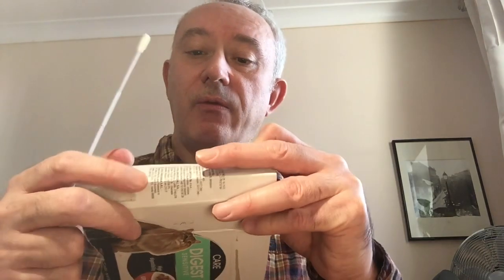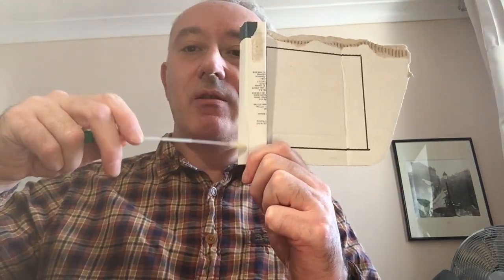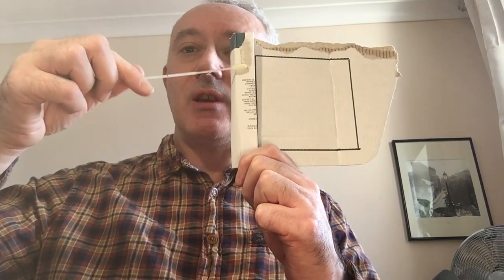Now if you're trying to sample something like a filling needle, that requires a different technique because all you have is something very thin. All you can do is rotate up and then rotate down.